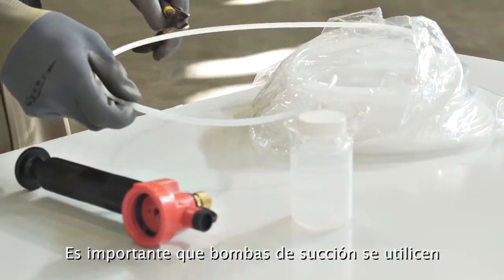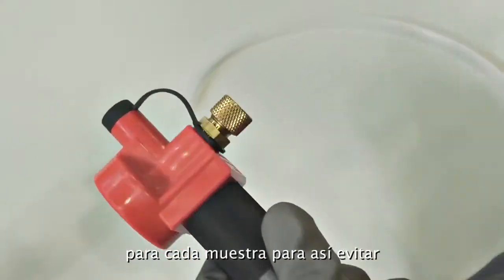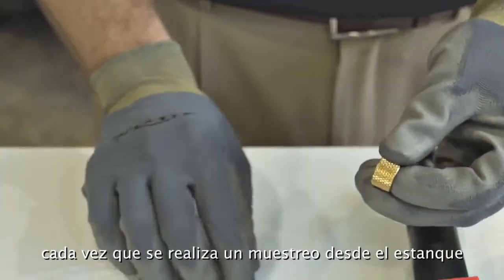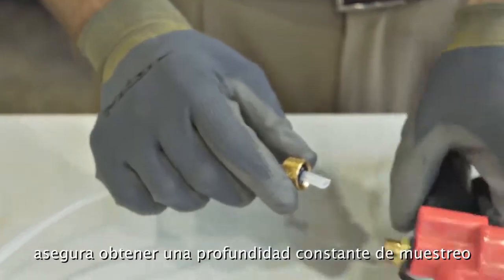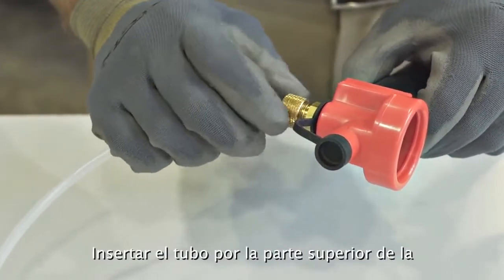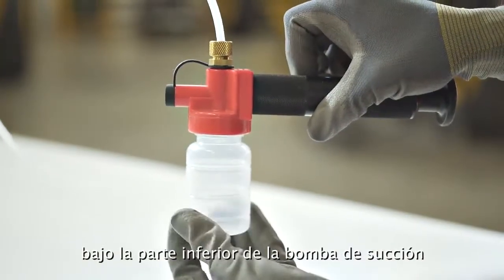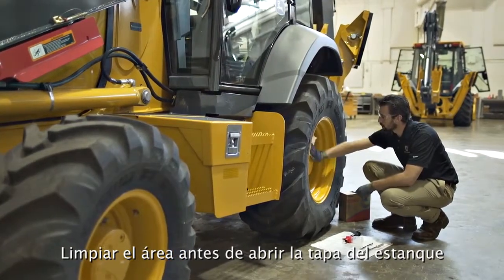It is important that vacuum pumps are used with appropriate tubing. Make sure that new tubing is used for each sample in order to avoid cross contamination. Using the same length of tubing each time you sample a particular reservoir helps ensure a consistent sampling depth within the reservoir. Aim for one-third to two-thirds from the surface of the fluid. Insert the tubing through the head of the vacuum pump and tighten the retaining nut. The tubing should extend about one-eighth of an inch beyond the base of the vacuum pump head.